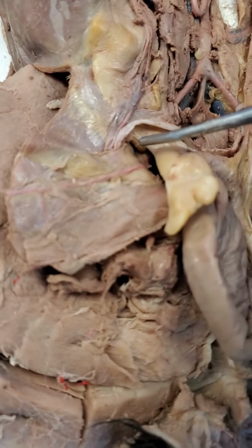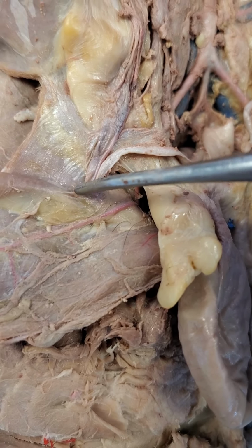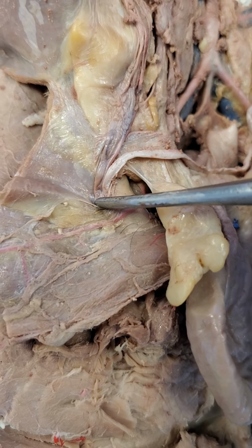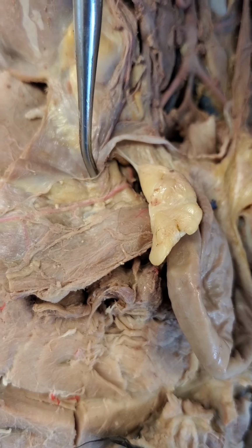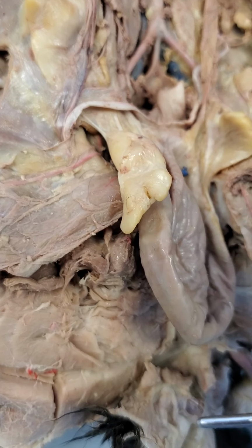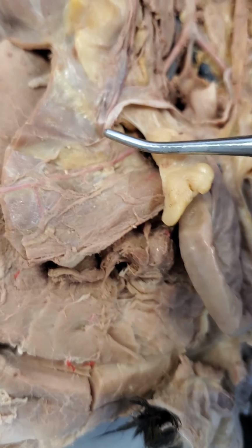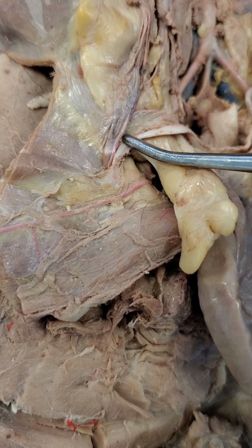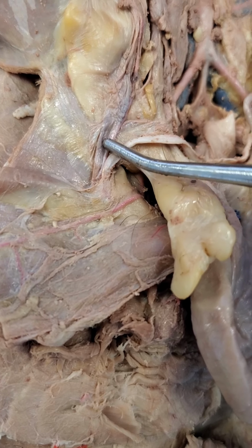And we'll actually see, if we look at the inside of the abdominal wall, there's a little hole where we can see the contents of that spermatic cord are actually entering the abdomen. So this hole right here that everything's coming out of, this is a canal right here that the probe is in, and that's called the inguinal canal. And so that spermatic cord runs inwards towards the abdominal cavity, and it goes through the abdominal wall, through this inguinal canal. And you can see right here the spermatic artery and the spermatic vein, as well as the nerves that are coming out of that inguinal canal.